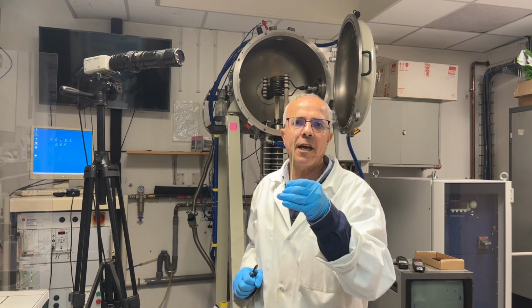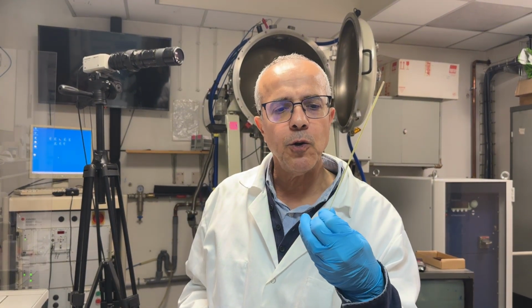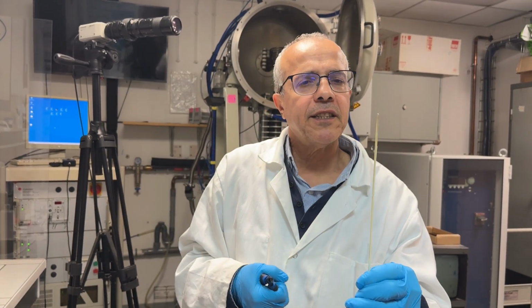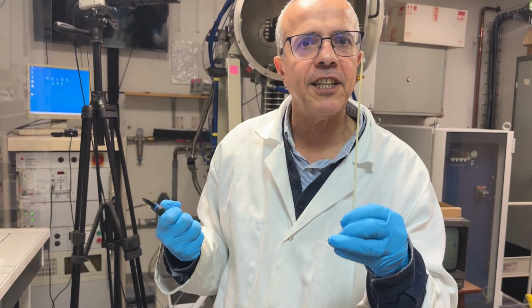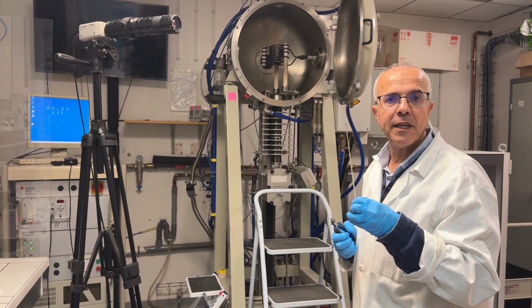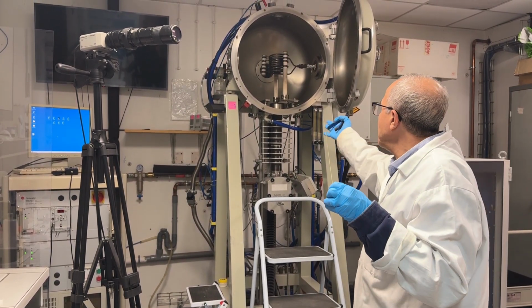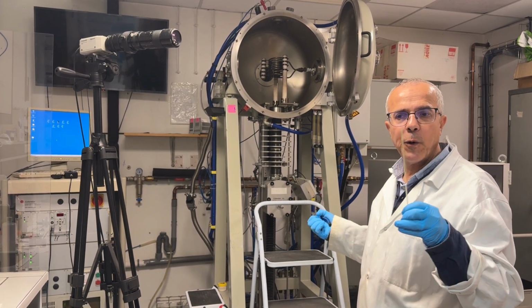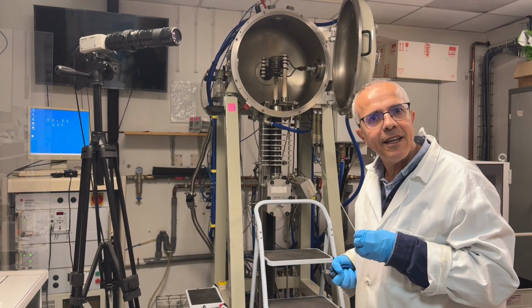It is slightly yellow because it contains a small amount of cerium, but the quality is good, and the crystal doesn't contain any defect. But we will do characterization to be sure that the crystal has a good quality. So we have finished a good experiment of the micro-PD technique. It has taken us 1 day, and you see everything is okay inside. So we can now prepare another crystal growth. Thank you for your attention, and let's meet soon.